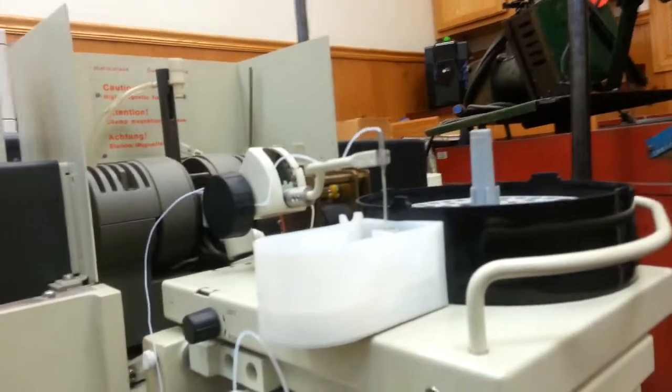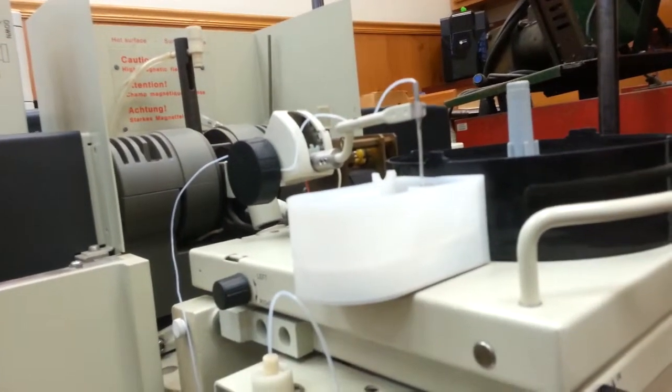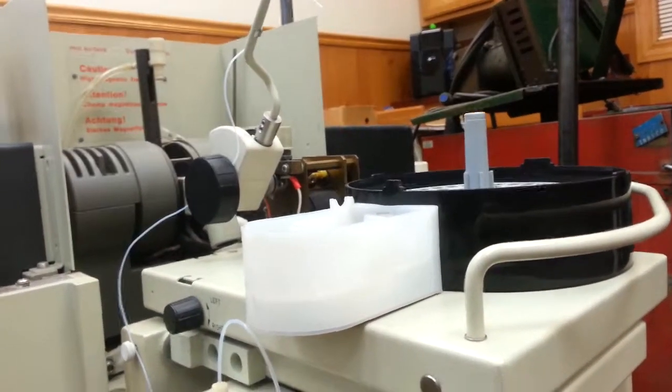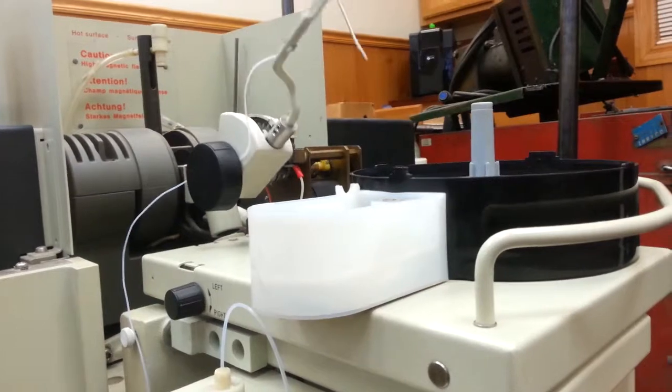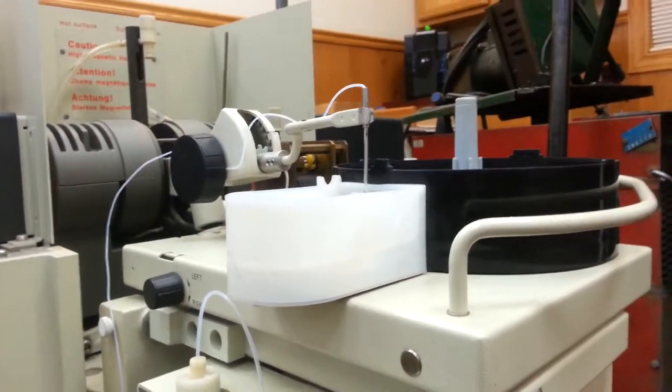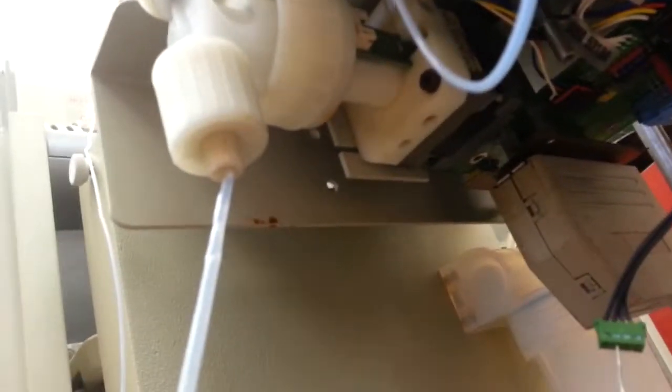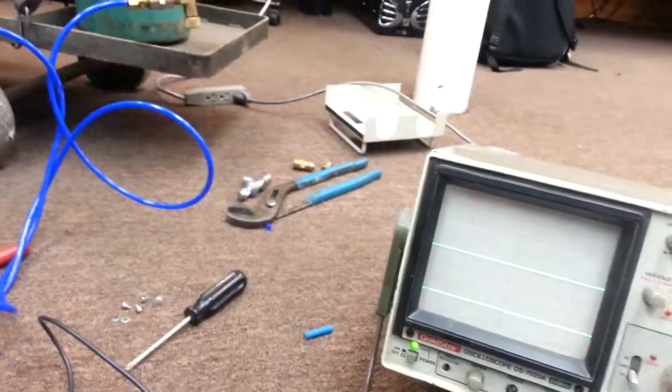And it's going to go through its usual test procedure. Alright, so that's the rinse motor engaging. And so it is actually turning back there. It just doesn't know when to stop. So the moment that I ground out the input for the Hall effect sensor, see it on the scope here, switch direction.